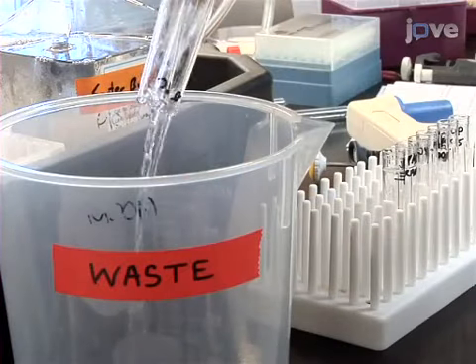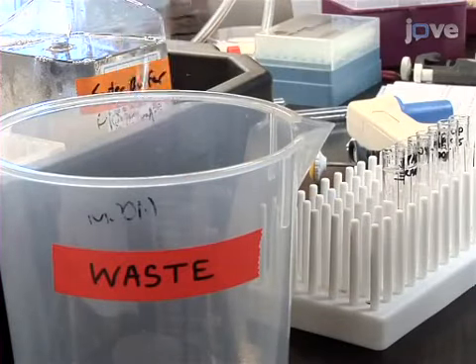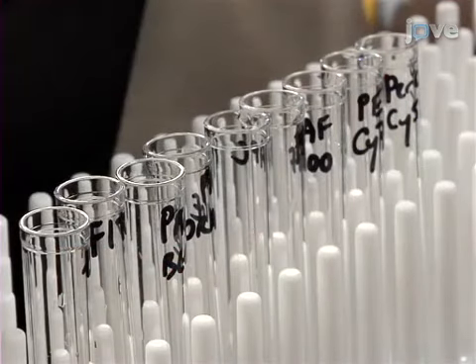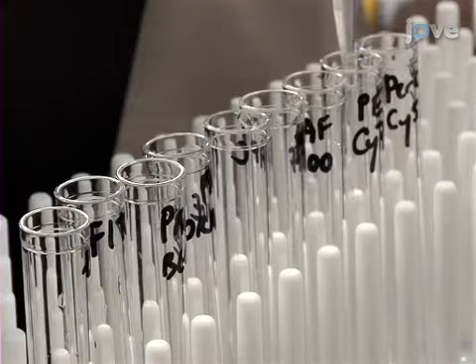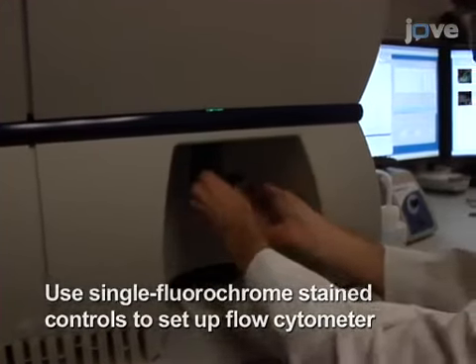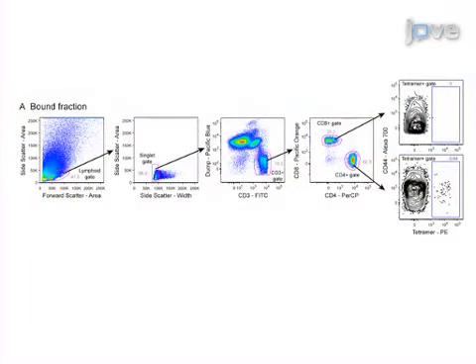For the unbound fraction and compensation controls, decant the supernatant and resuspend the pellets in 1 milliliter of sorter buffer. Analyze the stained samples using a sequence of successive inclusion gates for identifying CD4 positive or CD8 positive T cells as illustrated here.